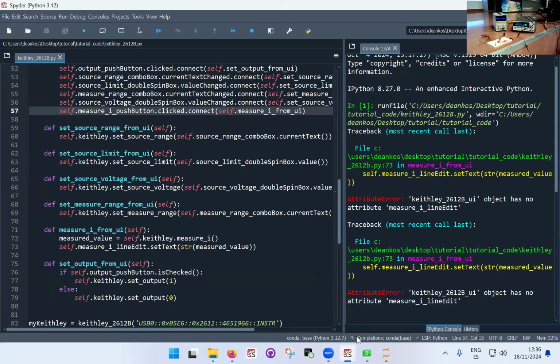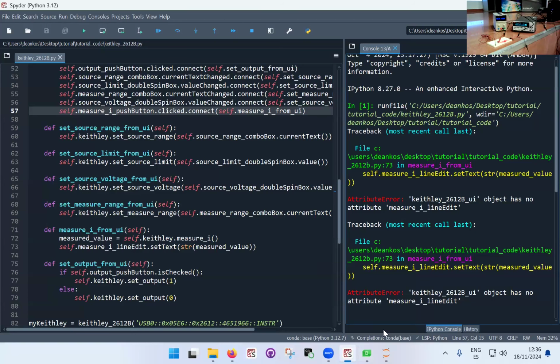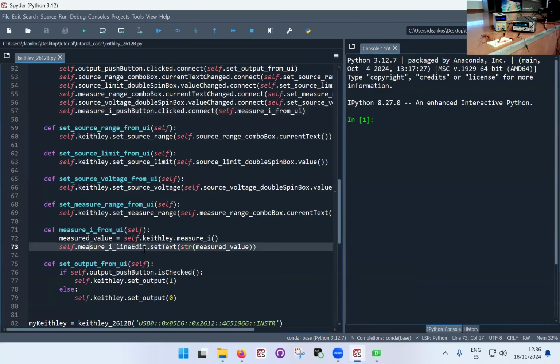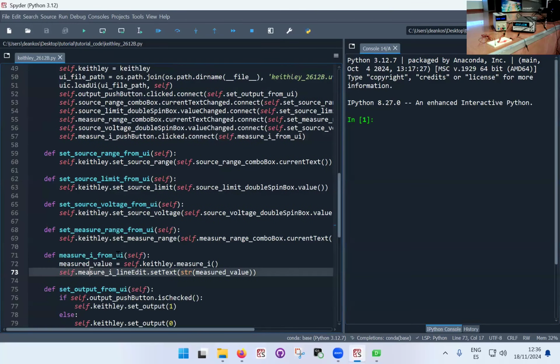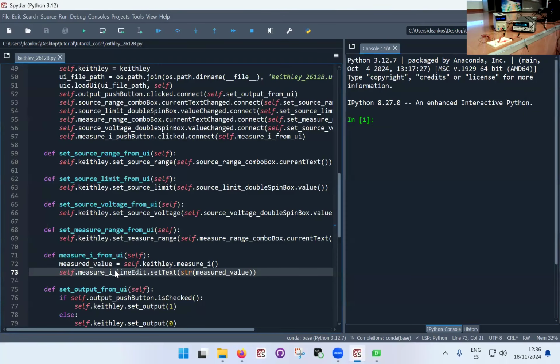I line edit. There's probably a typo somewhere. I'm just going to shut it. Let's see, measured value. So it's complained that it couldn't find the measure I line edit. Measure. Ah, thank you very much. Thank you. Measured. There we go. Let's see. We'll rerun it again.